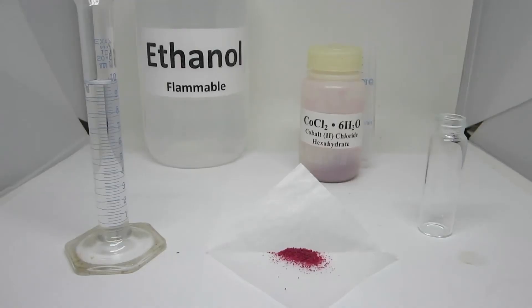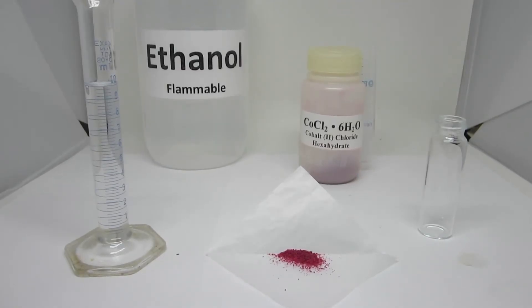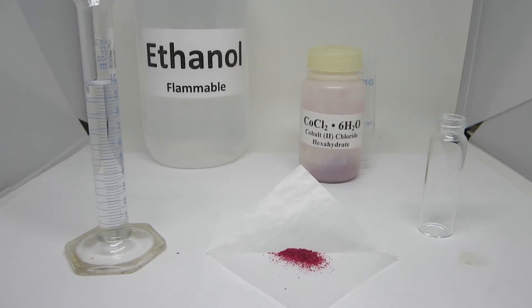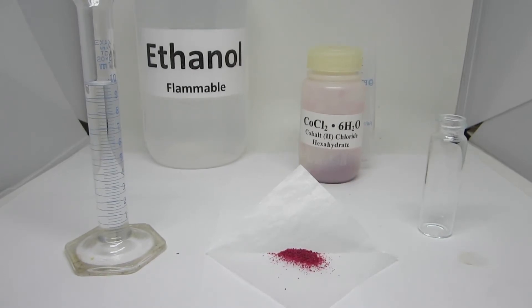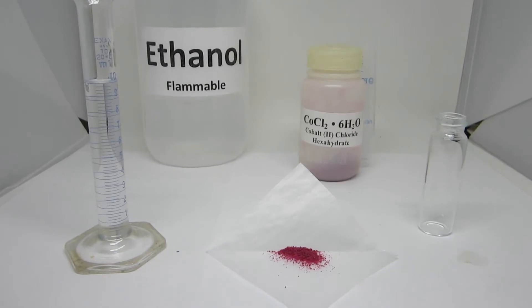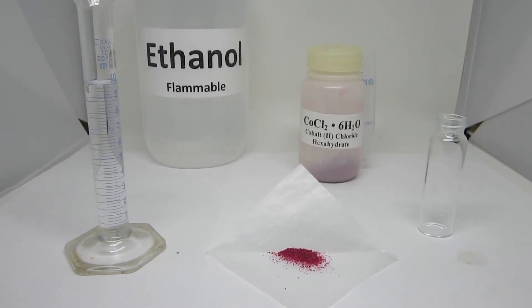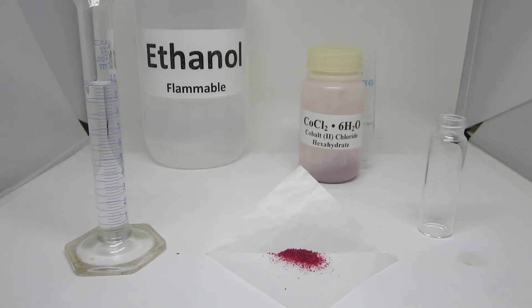If, however, the cobalt-chloride is dissolved in an anhydrous solution — one that does not contain water — how will this affect the overall appearance and therefore the overall equilibrium of the reaction?